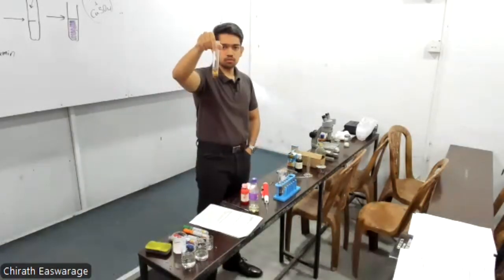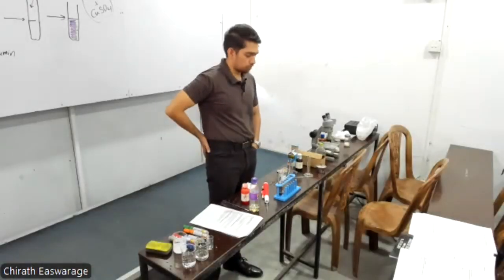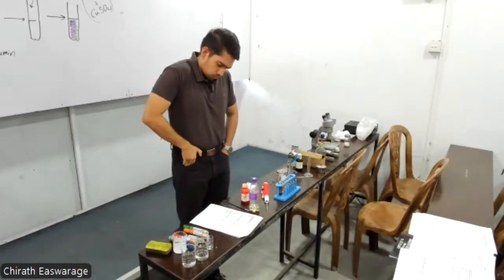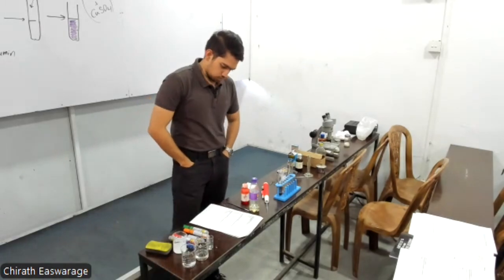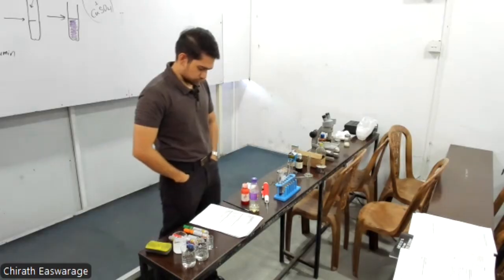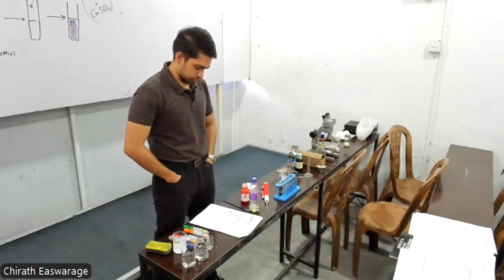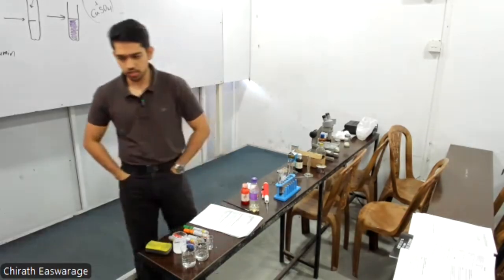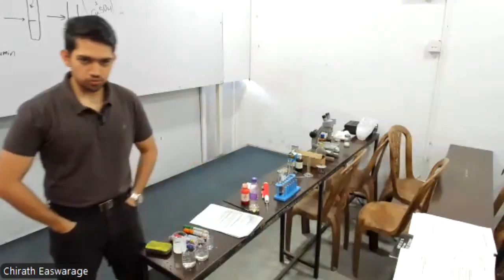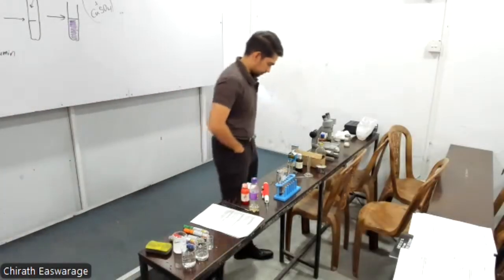So with time, okay, it's a non-polar dye. What's the test? About 2 milliliters of oil into a test tube, equal volume of water into the same test tube, few drops of Sudan 3 and shake well. Red stained oil layer separates on the surface of the water. Right? Usually oil has less density than water, right? So oil is supposed to float on the water. Okay, let's try then.